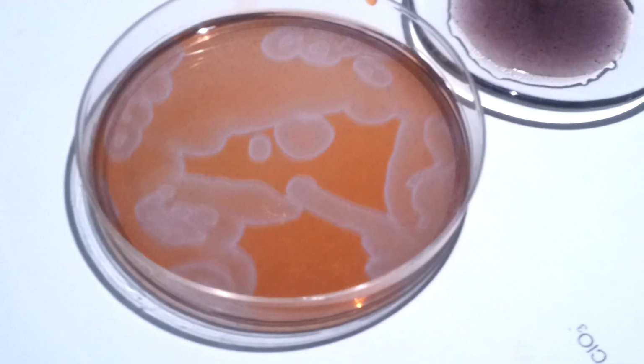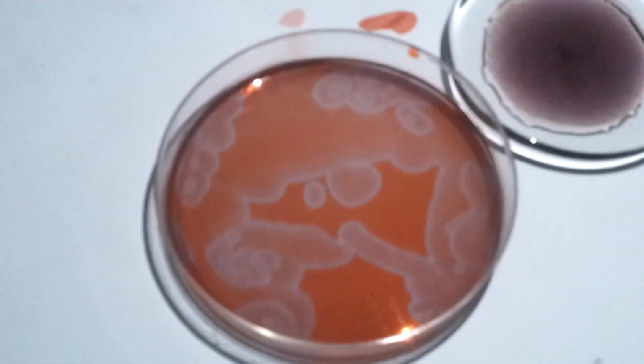I think the coolest part to watch is if you try to follow the edge when it actually bounces off the side, just like a normal wave in sound or light or anything. That's what's kind of cool about this.